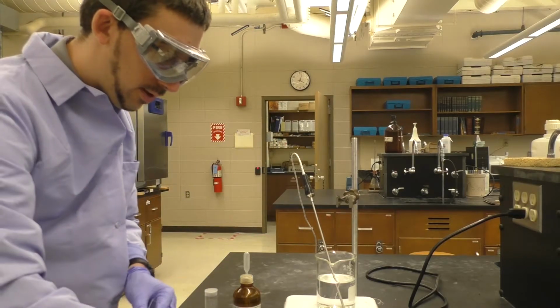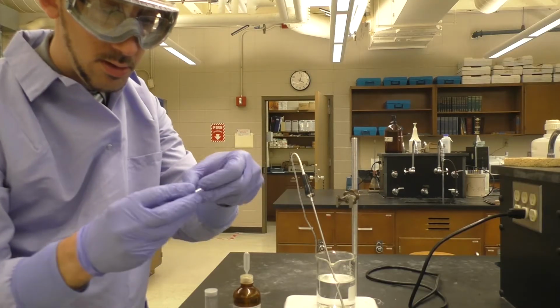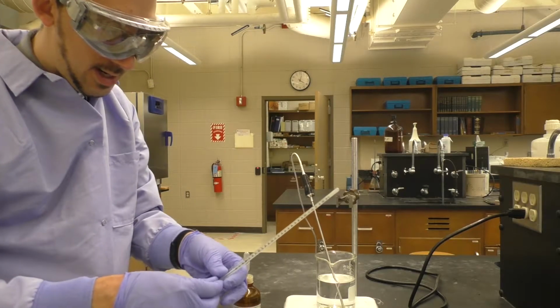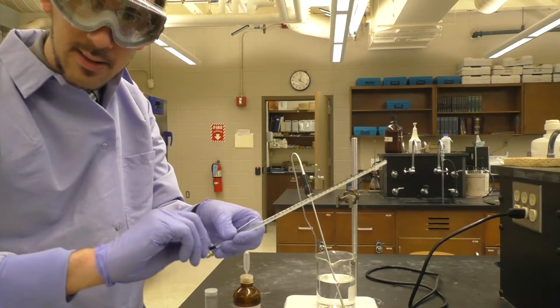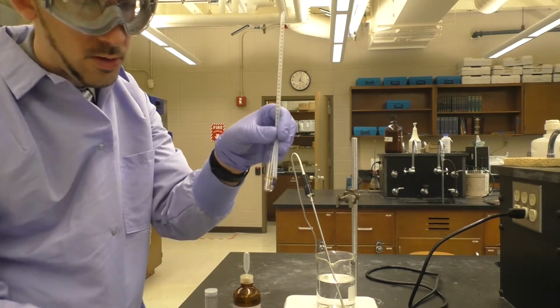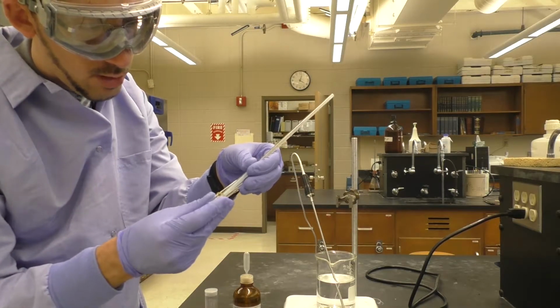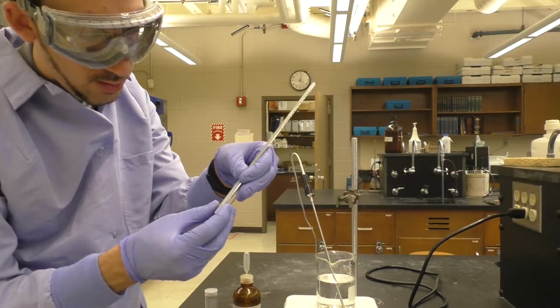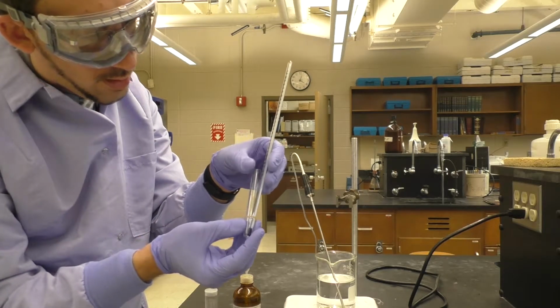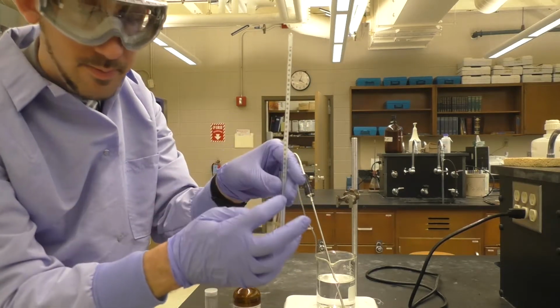The best way to do this is to first put the rubber band onto the test tube. I've got the rubber band onto the test tube, and then slide the thermometer next to it and simply stretch the rubber band over the thermometer. Now, of course, they're not even, so now you just have to spread it up, adjust the thermometer so that they're about even. You also want to just adjust it, spin the thermometer so that you can see the markings.